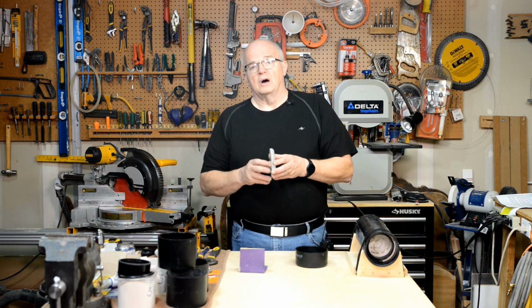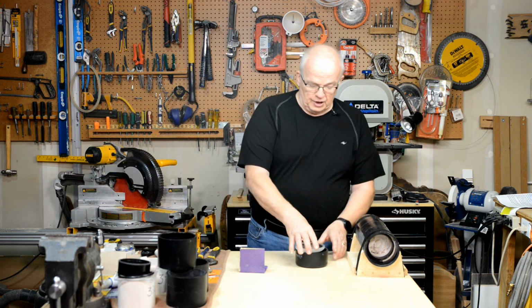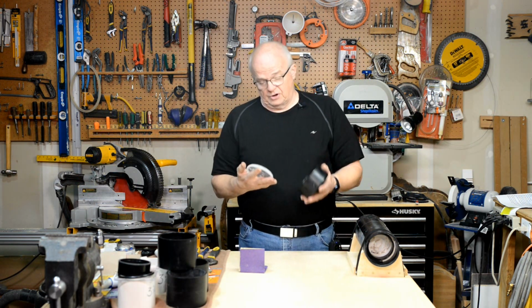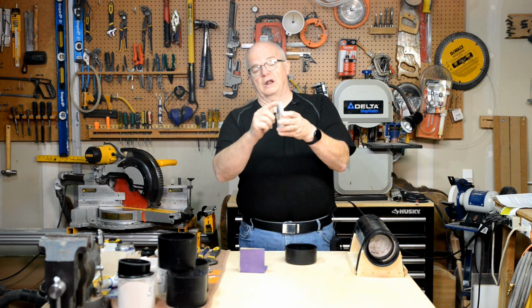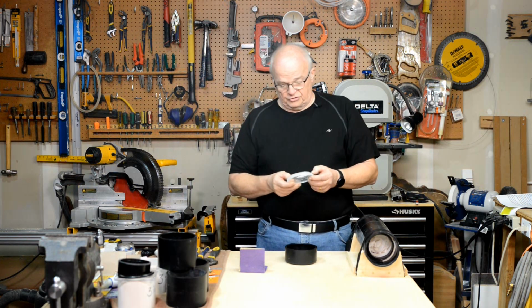Second thing I want you to do is grab this piece of acrylic, the one that's solid, the one that doesn't have the hole in it, because we're going to glue that into that end cap, okay? You should have it so that it sits down in there quite easily, moves in and out, it's not tight. And you want to have that bevel around that outside edge, okay? I explained why you want that in video number 2.